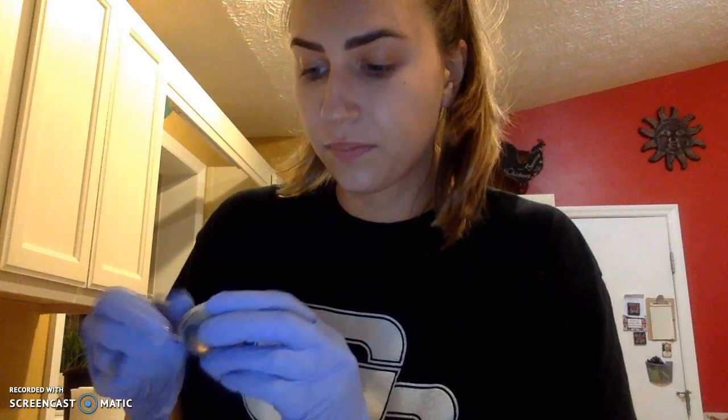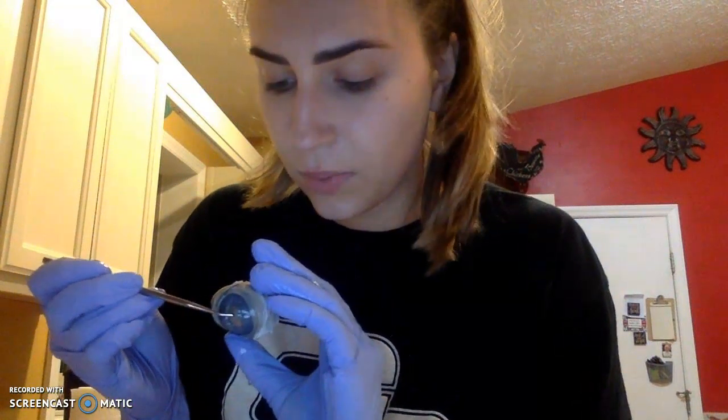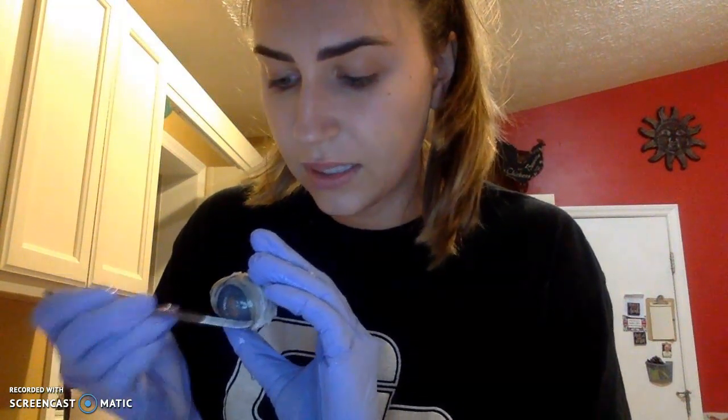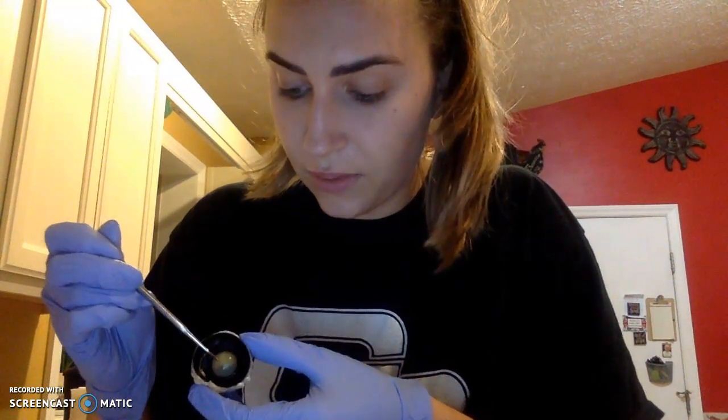Looking at the anterior cavity of the eyeball, again, we had the cornea with the aqueous humor liquid coming out once I cut it, and the sclera. Looking inside of it, this outer portion right here, we're going to have our iris. Then right here, this hard, firm portion will be the lens. There's the iris, and then our lens right here.